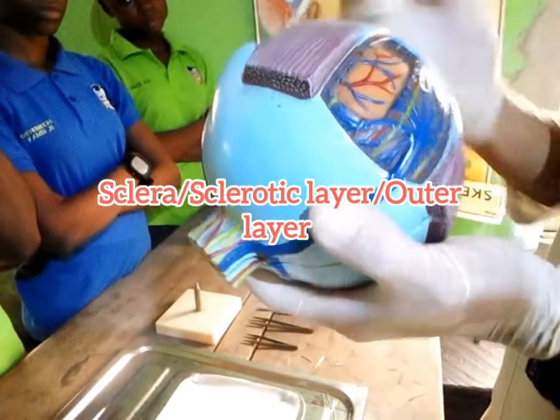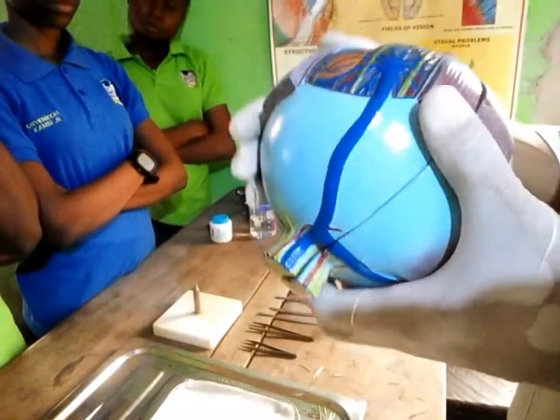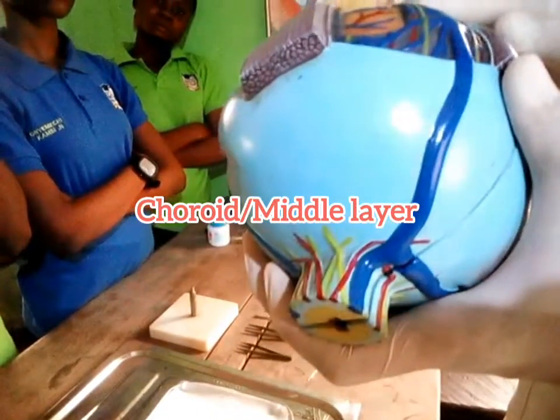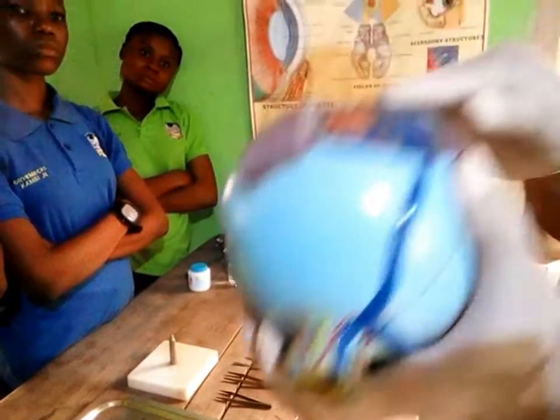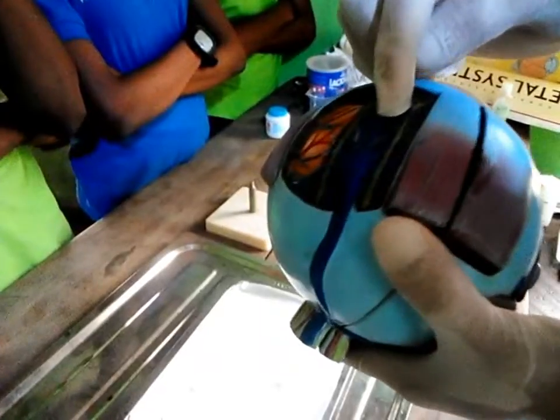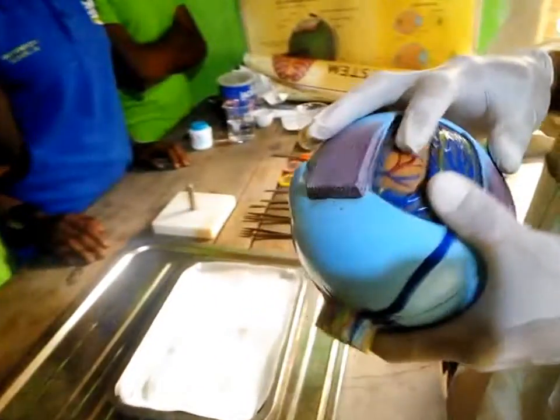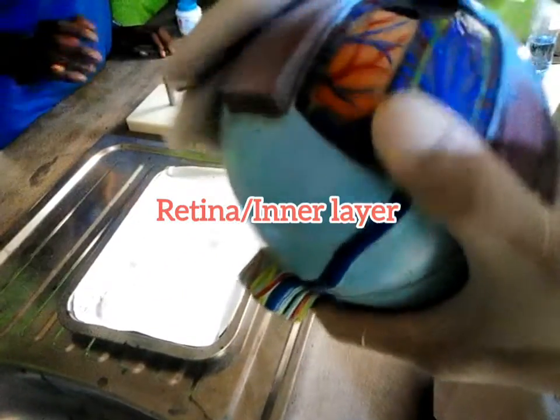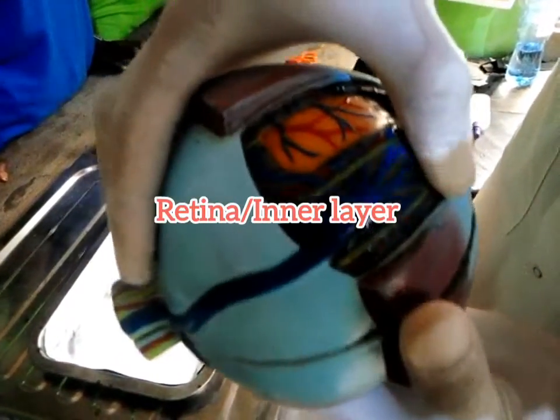Now below the sclerotic layer is the part called the choroid. And the choroid, I believe, is this part that you are seeing now. Yes, this is the choroid. Now after that, you have the last layer. This last layer doesn't really extend to the front, and that's the part called the retina. Now I'm going to open this so you can see it more clearly.